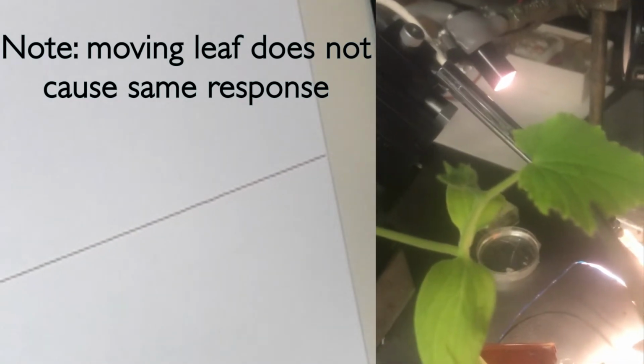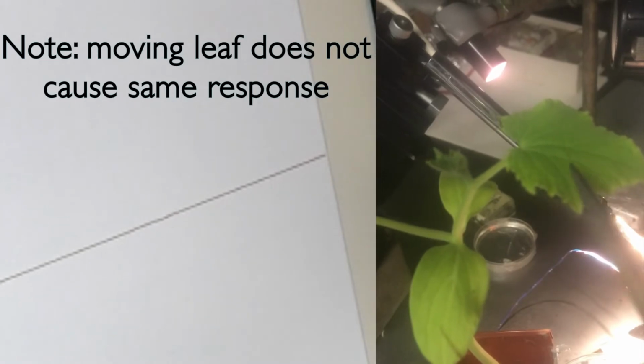And I'm touching it pretty hard, the same amount that I would cut it, and it doesn't give the same kind of artifact. So that's pretty cool. And let's go to a different leaf. Let's go to this leaf.